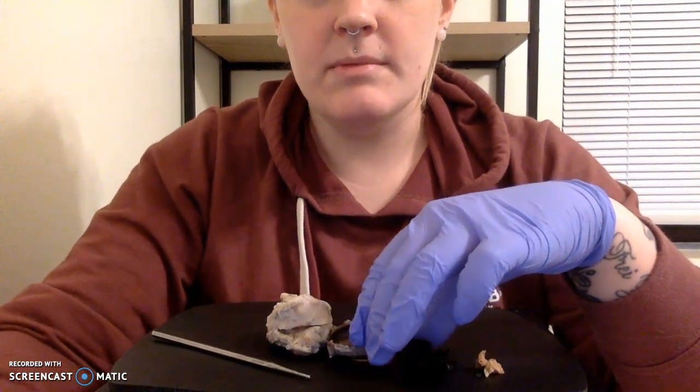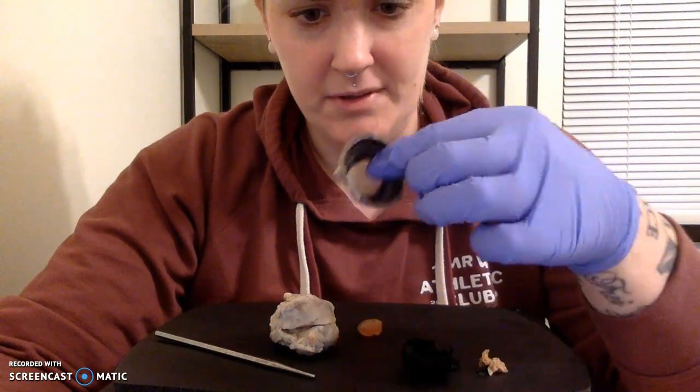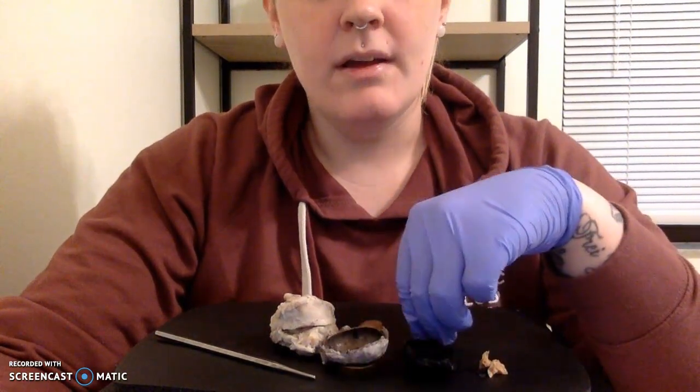So hopefully you got some information from that. Again, I'm so sorry. I'm not sure that that was the clearest dissection, but we did our best.